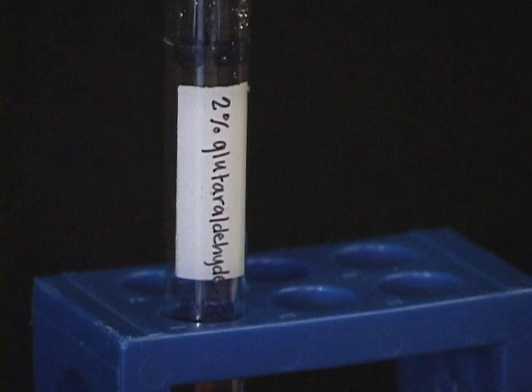Dilute stock of glutaraldehyde to 2% in BRB80. Our glutaraldehyde is from Fisher Scientific. Dilutions and handling of glutaraldehyde should be done in the hood.